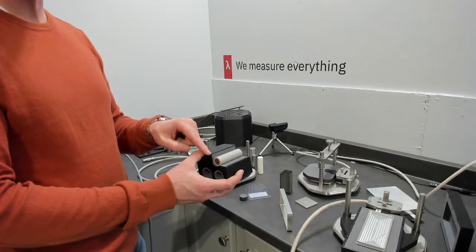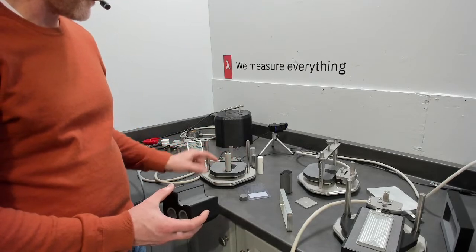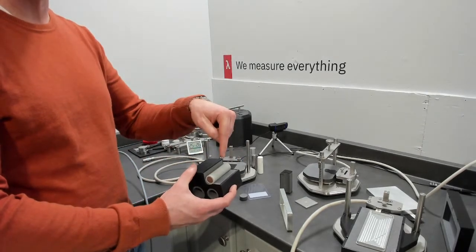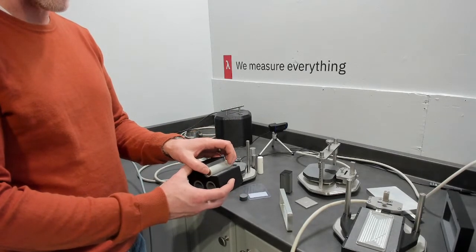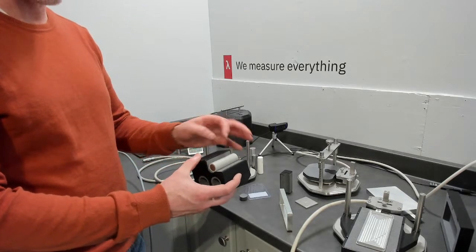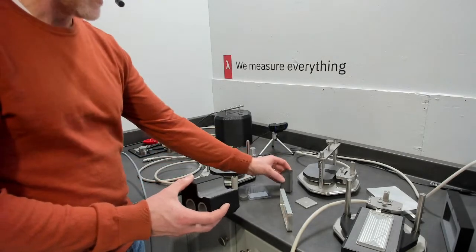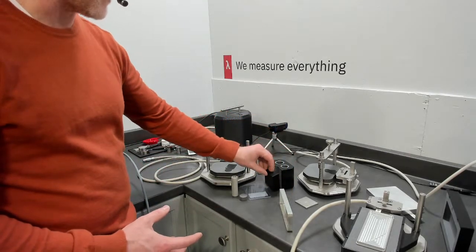If you have good correlation between your one-dimensional measurement, like this, and your single-sided or asymmetric test, where you get this direction and into it, that's a pretty good indication your values are close to the true value. There is some uncertainty caused by the construction of the material, but you can get pretty good values. We like to discuss the uncertainty of our measurements. I think it's important to understand that when you're using this data and you expect accurate results.